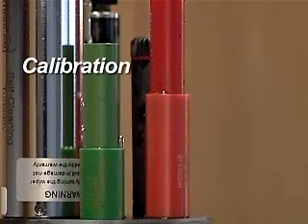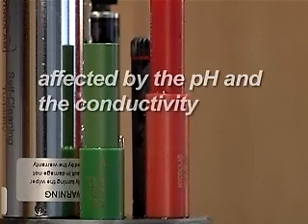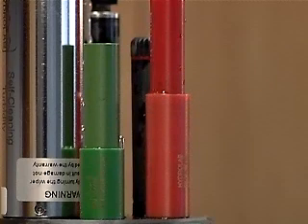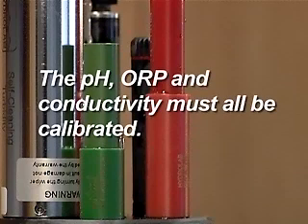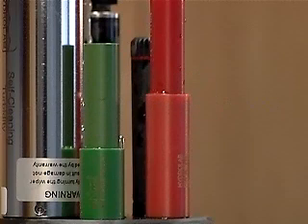The ion activity in a solution is affected by the pH and conductivity of the solution. Prior to calibrating any of the ion sensors, the pH, ORP, and conductivity must be calibrated. If installing a replacement tip, the specific ion tip should be hydrated 24 hours prior to calibration.